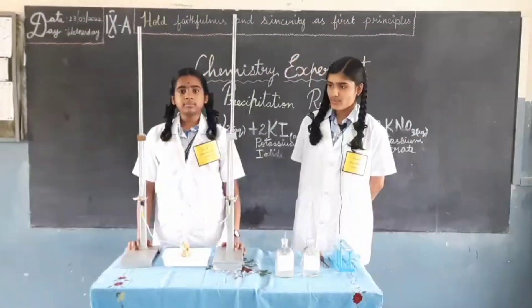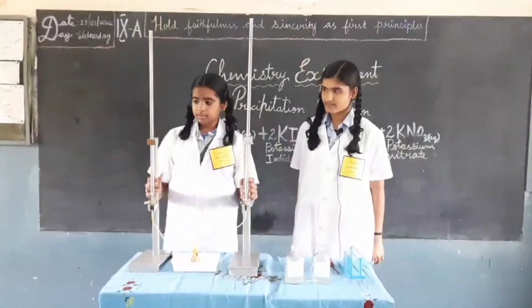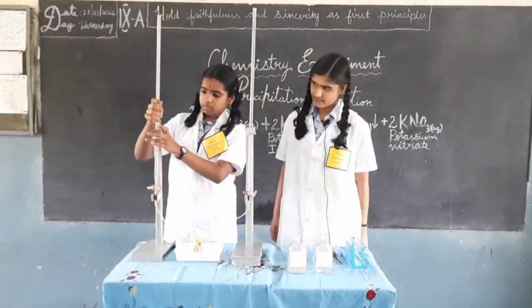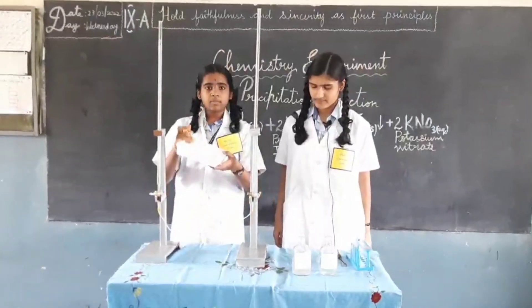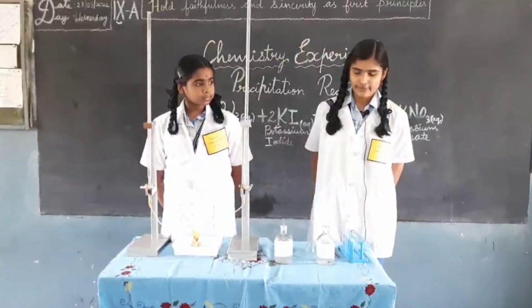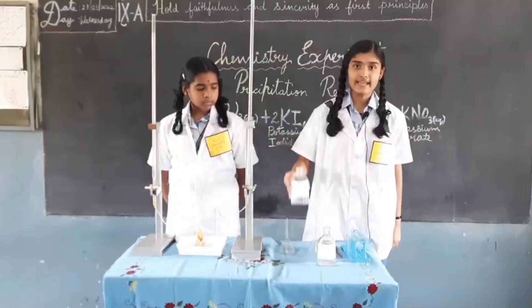The apparatus required for this experiment are two burette stands, two burettes, a tray, funnels, and a test tube. The chemicals required for this experiment are potassium iodide and lead nitrate.